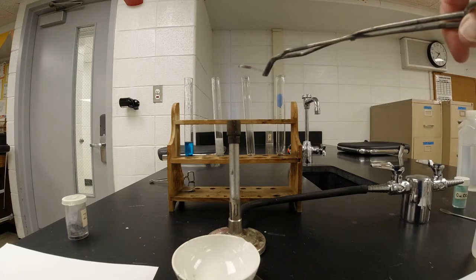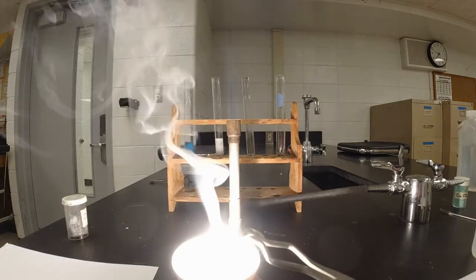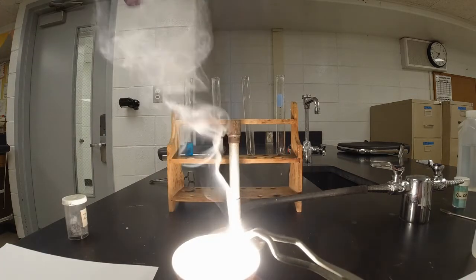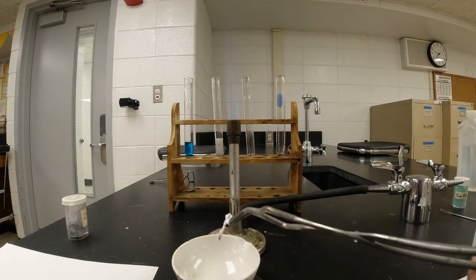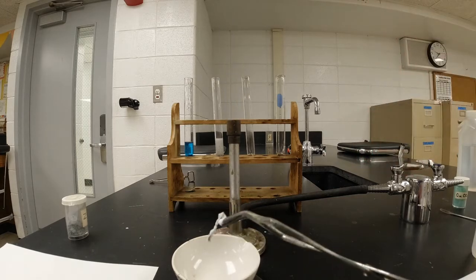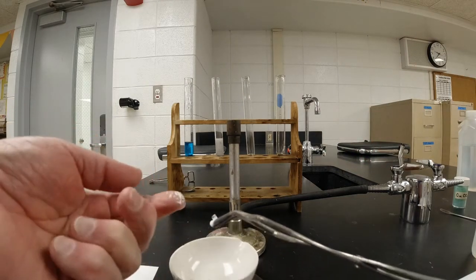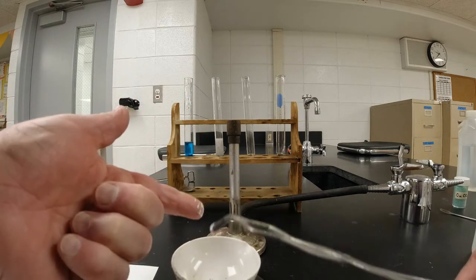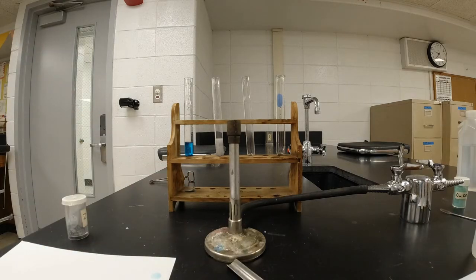I'm going to hold it in the hottest part of the flame. And if you were here, I would say don't look directly at it while it burns. And I'm going to hold it over the top of the evaporating dish, so in case it falls, I certainly don't want to catch it with my hand or let it hit the table. And then it goes out. And what's left is a white powdery stuff. And this white powdery stuff, it's all brittle. It's not the same anymore. That is magnesium combined with oxygen. All right, so we're going to set that to the side now.